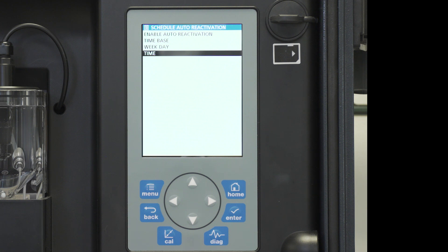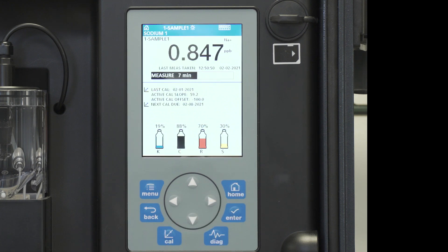The instrument is now set up to automatically reactivate on Mondays and Thursdays at 1 a.m. in the morning. Press home and we move back to the main screen.